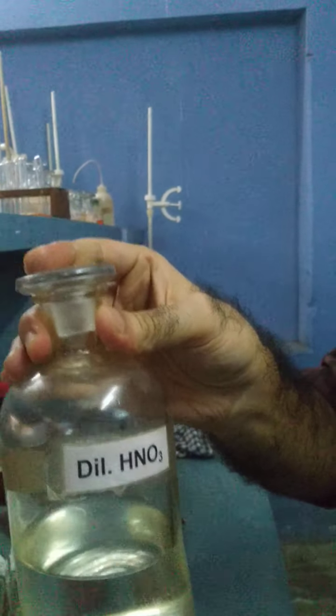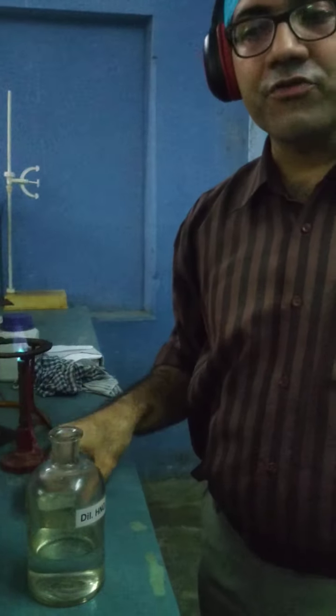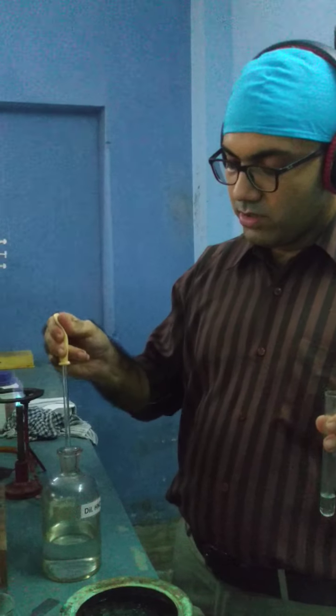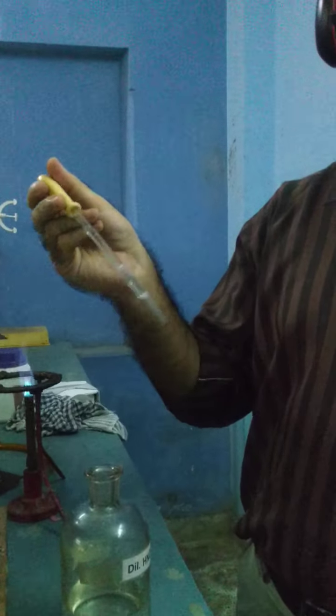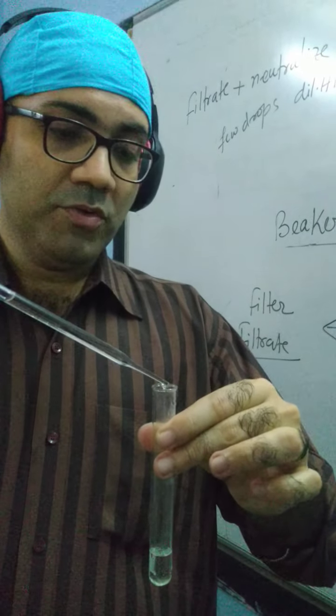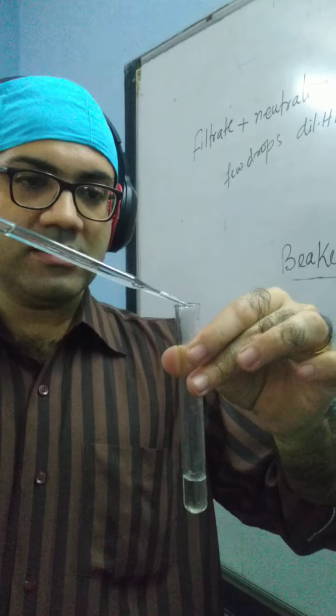You can see over here, dilute nitric acid. We will add dilute nitric acid drop by drop, dropwise. Why? To neutralize. I told you we need to neutralize the solution. All right. We have taken a dropper, as I told you, and I will add drop by drop. You will see effervescence. Can you see effervescence?